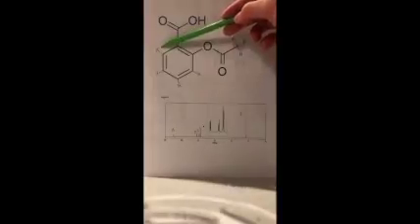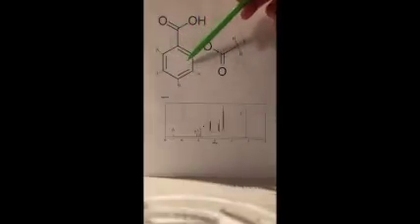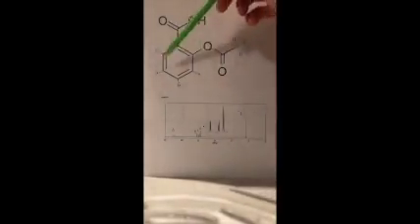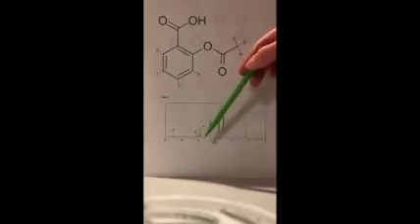And then C, because it is roughly the same, all 3 of these signals are quite close together just because they are in approximately the same chemical environment, being in this aromatic ring. You are also typically going to see signals in a benzene ring such as this always around 7 to 8 ppm, which is why we see these multiplets here.